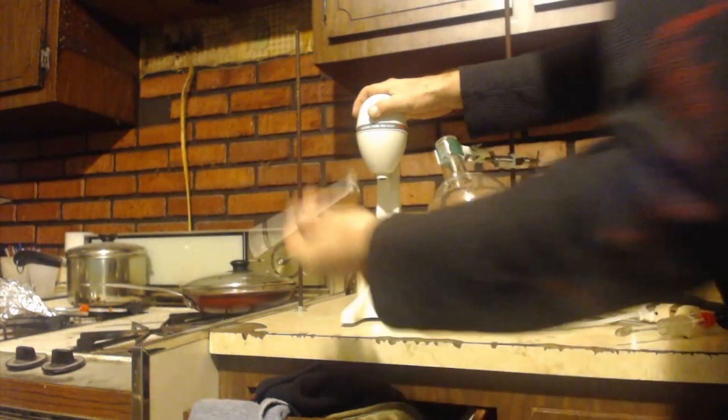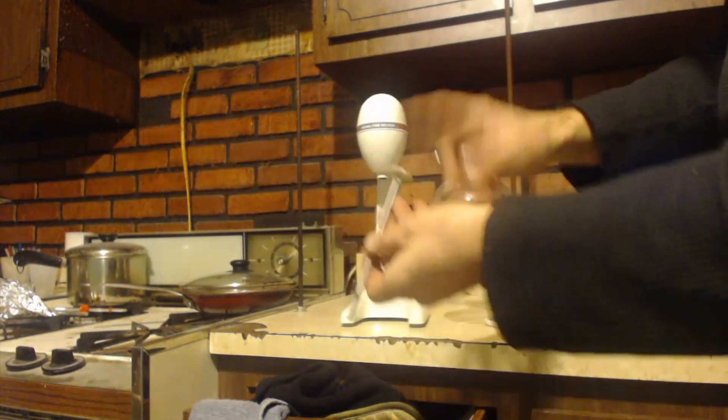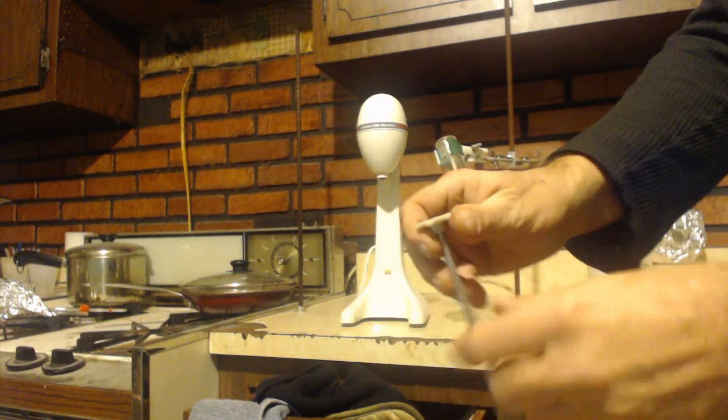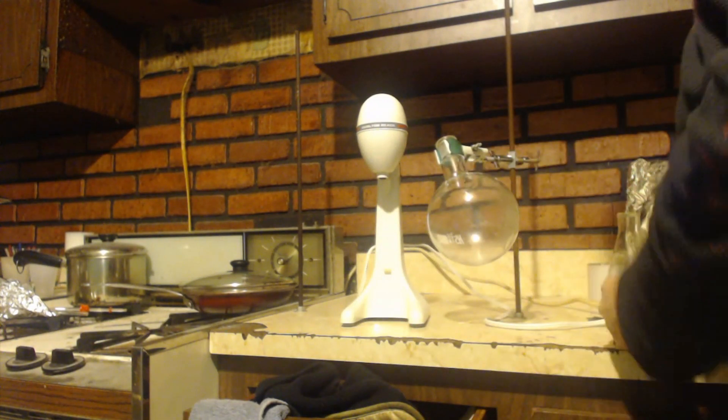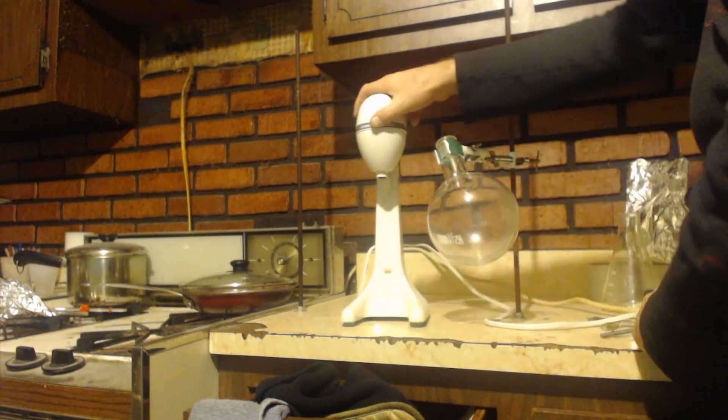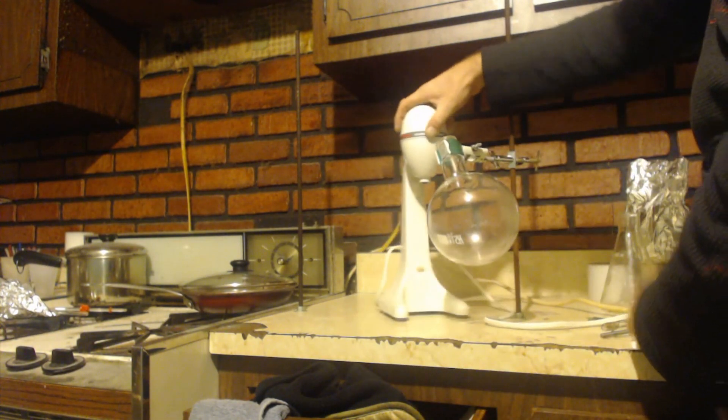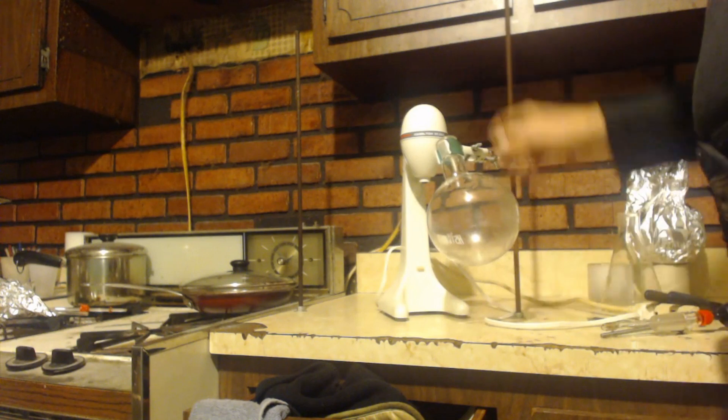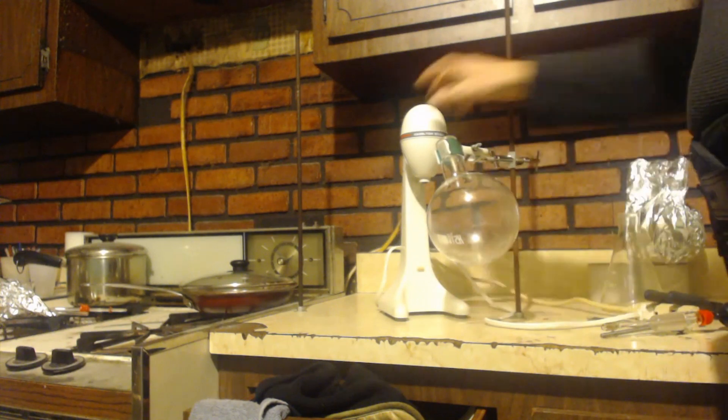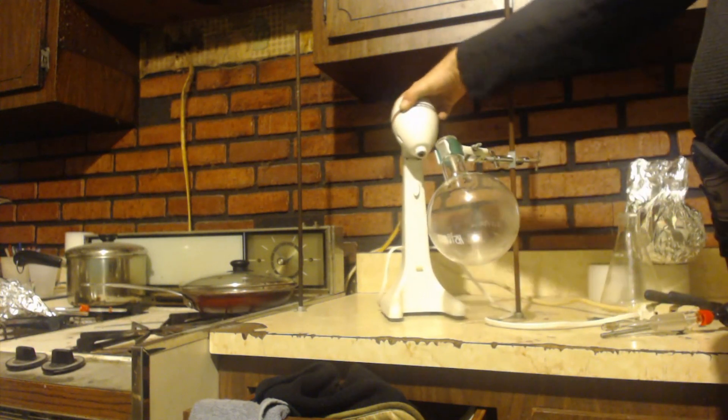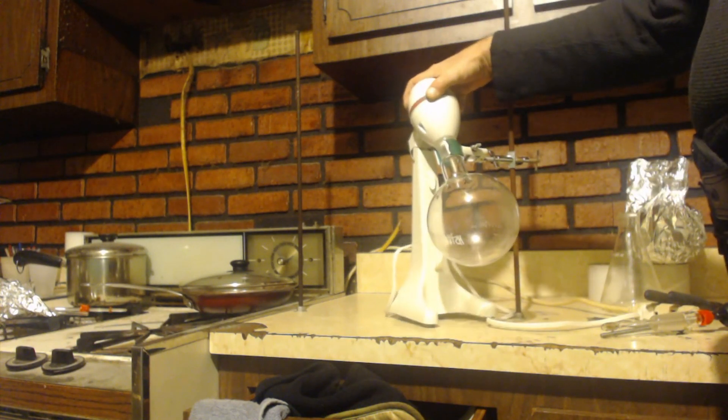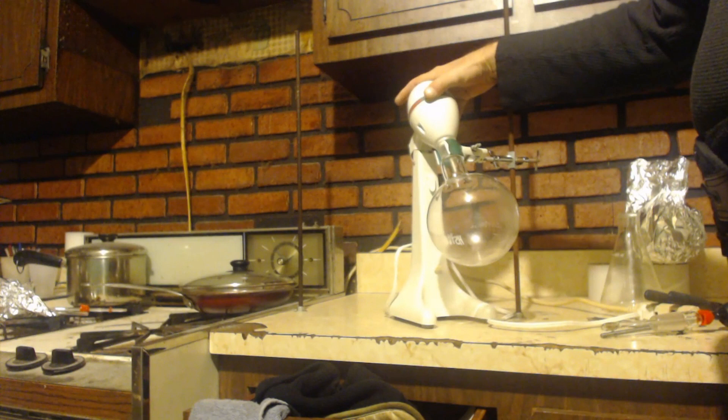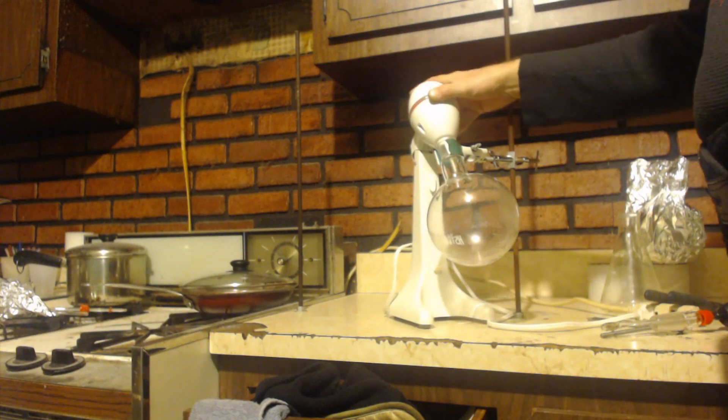Let's say I ripped this plastic thing off and I can actually get it in there. I could come over here and you can see I have it clamped so that it's at an angle, and just put this at the angle, you can see it'll go right in there.